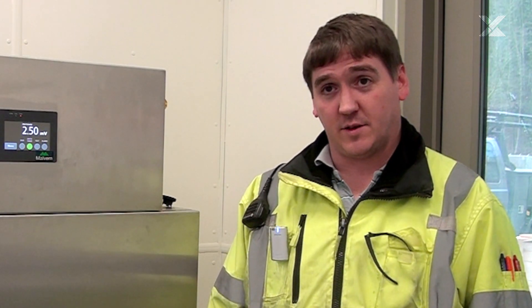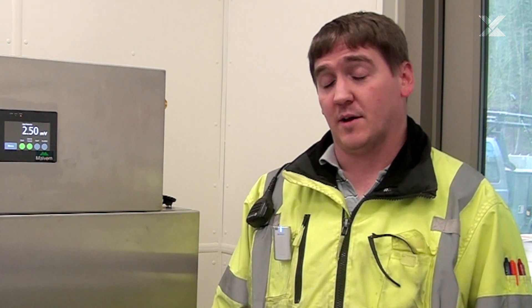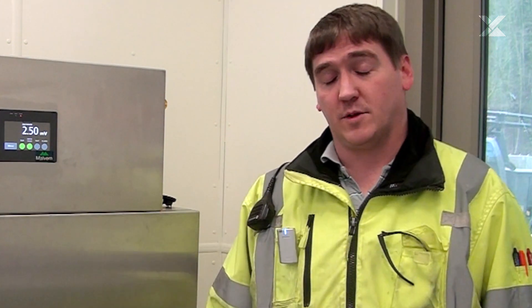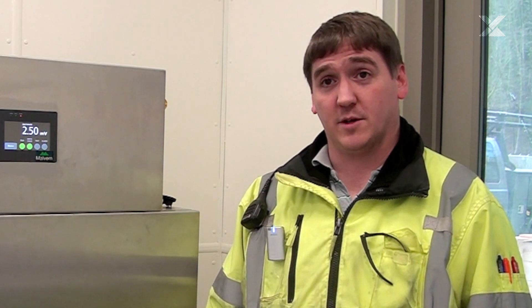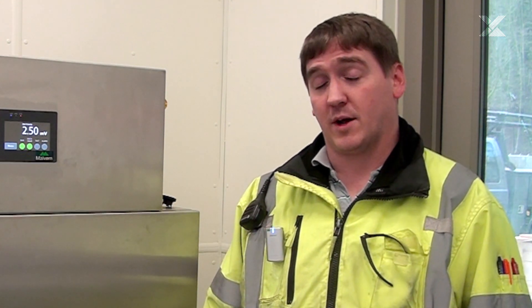Everybody's been able to run their own zeta standard and teach one another about the numbers they're getting. You get a feel for it — if I'm at negative 3, I know I'm going to have to make a dose change soon, but if I'm at negative 11, the plant is falling apart. Everybody has got a good sense of it. It's really simple to do, keeping the cuvettes clean. Operators have been very savvy with lab techniques, so this is just one more addition to keep things stable. I think everybody's been happy with the results because it gives them satisfaction that the dose change they made is correct.